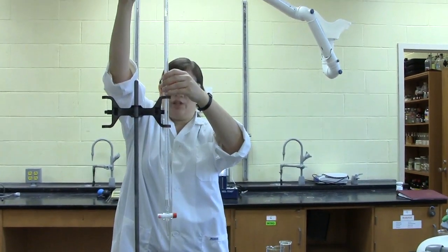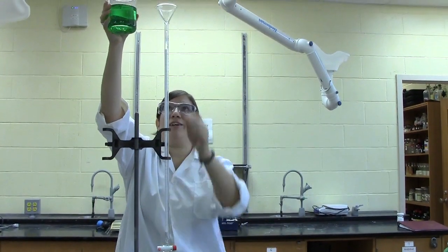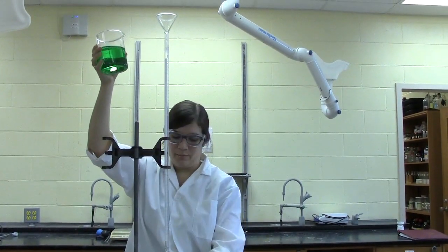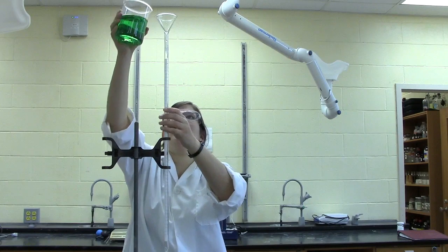Next, you fill your burette with whichever solution you're using. Again, make sure that your valve is closed, and you can place a beaker underneath just to catch any drops that might fall.